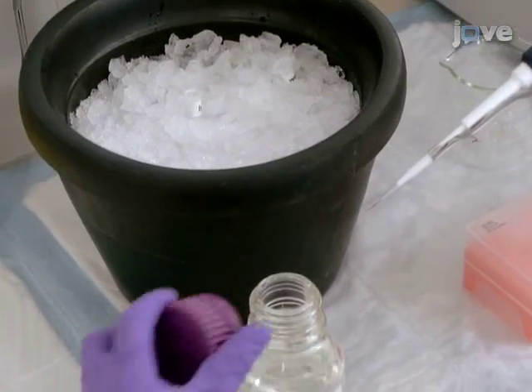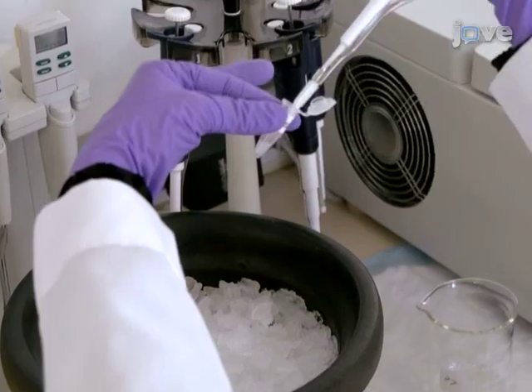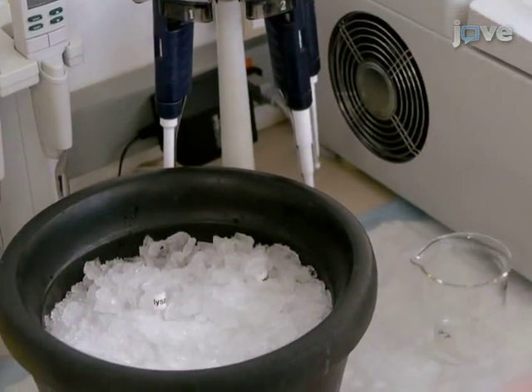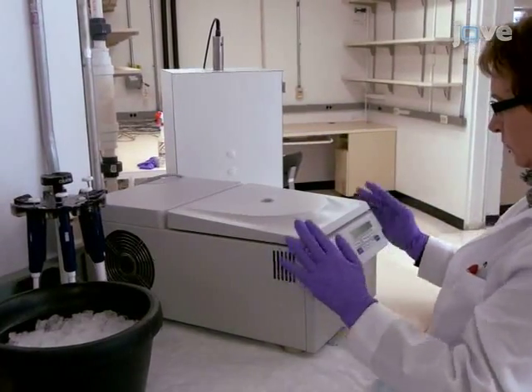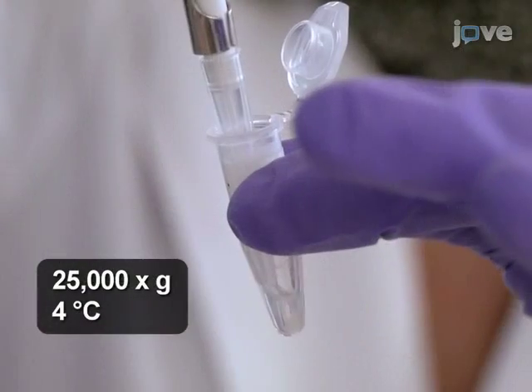Correct the lysate solution to contain a physiological salt concentration of 100 millimolar sodium chloride if necessary from a stock solution of 5 molar sodium chloride. Finally, collect the lysates by centrifugation at about 25,000 Gs and 4 degrees Celsius for 10 minutes.